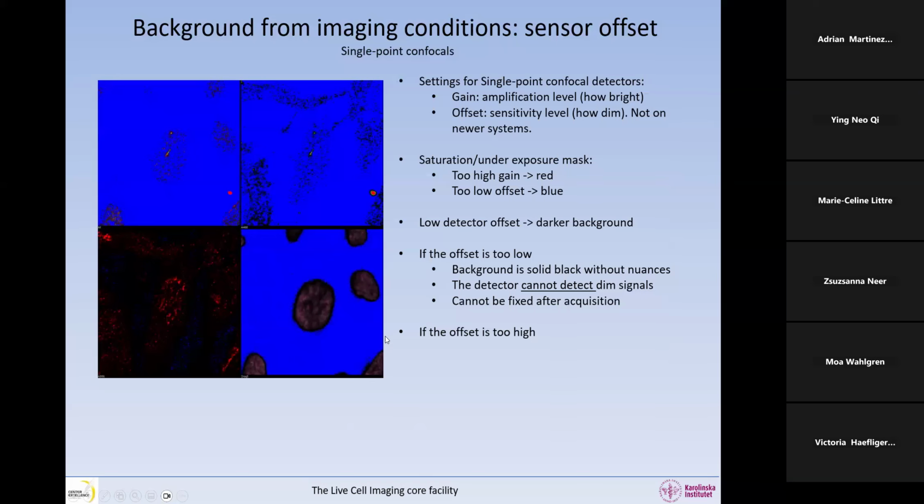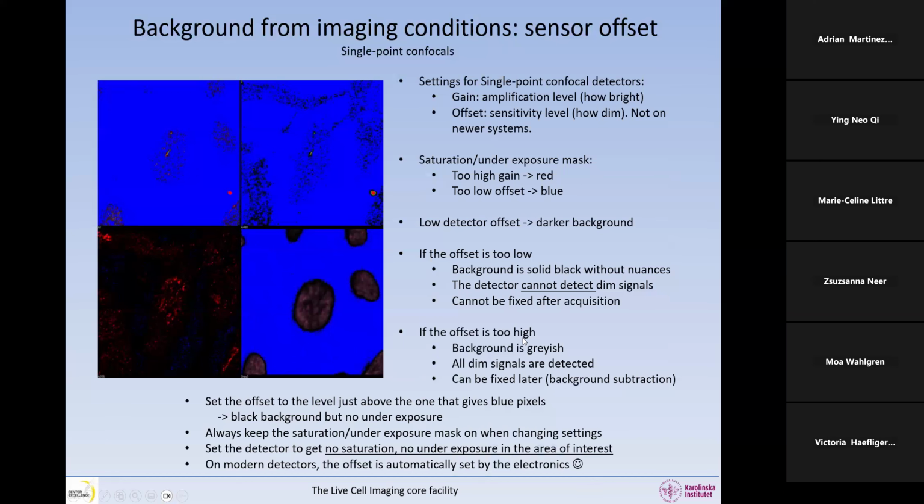If in another way the offset is too high, what we will have when we remove this blue color mask is that the background is going to be a little bit gray. Okay, it's better to have the background gray than completely underexposed like this. Because if you have the background gray anyway, all the dim signals are detected, so you're not missing anything. And that can be fixed afterwards. You can do some background subtraction afterwards. So it's better to have an offset too high than too low.